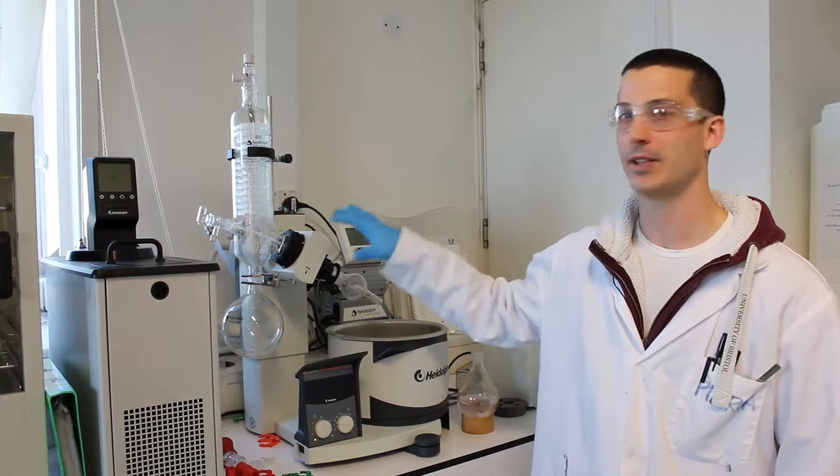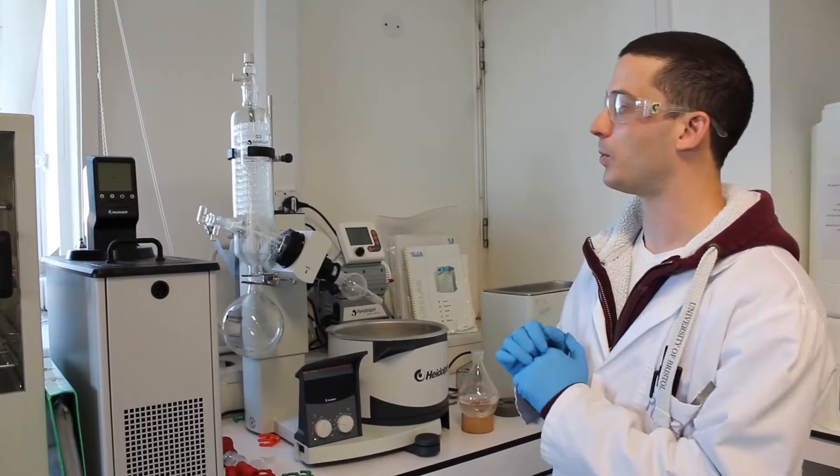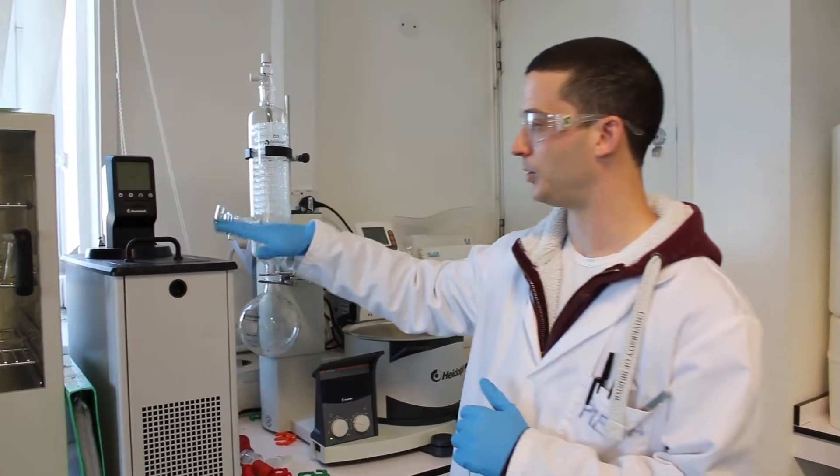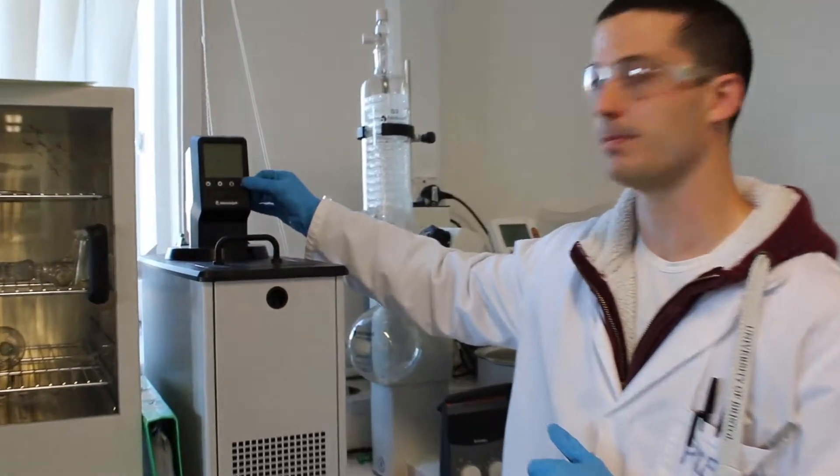Hello beautiful people, so today we're going to learn how to use the rotary evaporator. First thing first, we're going to turn on the chiller and to do that we just need to press this button here.